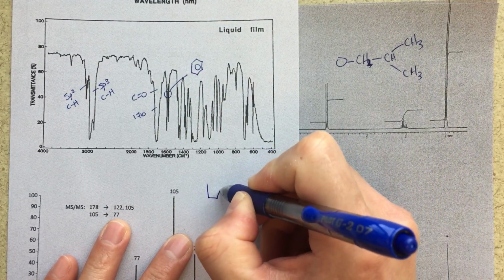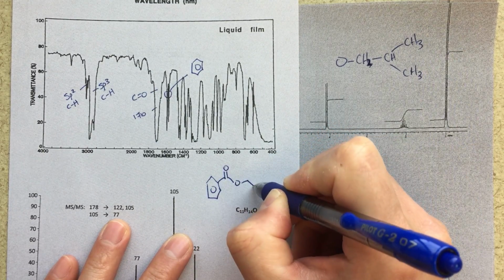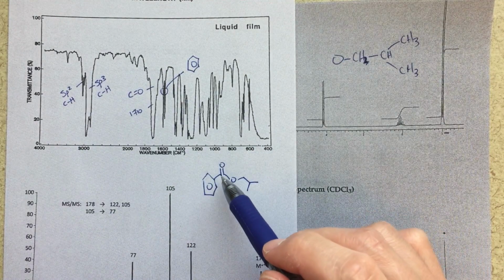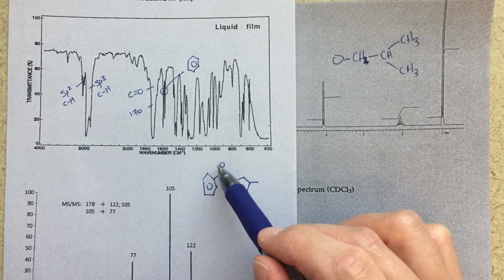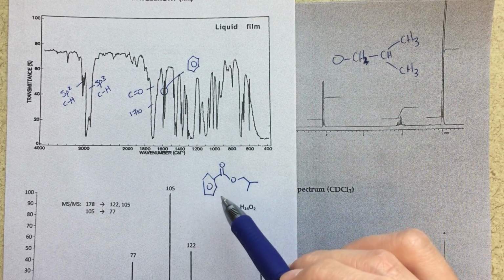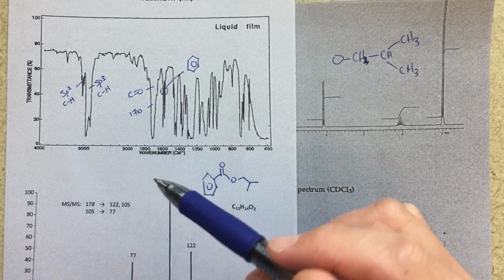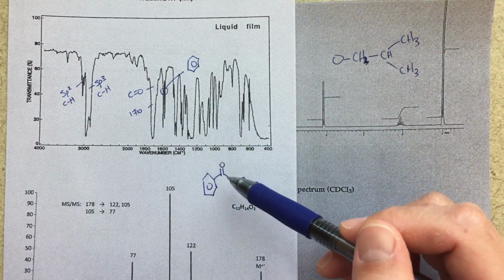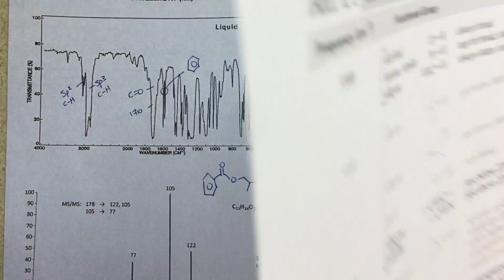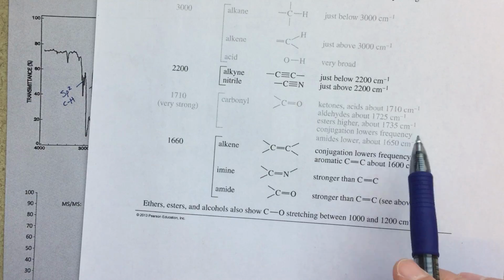So what I'm going to draw out is my first go. And the way that I came up with this is I thought about my benzene ring, and I thought about my C=O. I had ester in my mind from before, and I started with that. And the fact that I have a 1710 shift for my C=O, to me that really suggests I've got a conjugated C=O. I've got a conjugated ester, because my table here says that esters should come at about 1735, but that conjugation is going to lower the frequency.